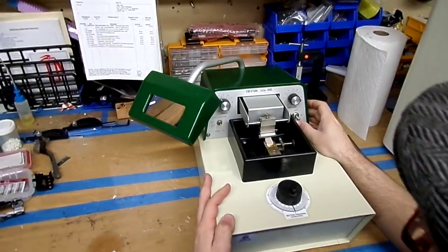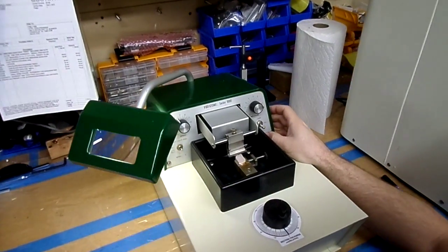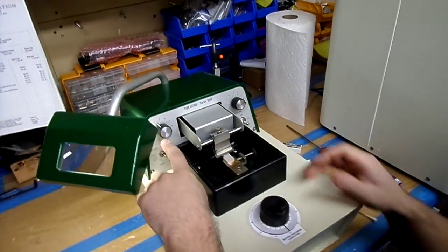You go ahead and turn it on, turn the lamp on, set your amplitude and your speed.